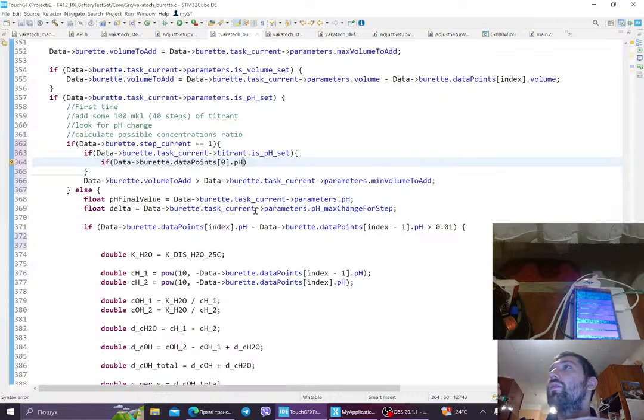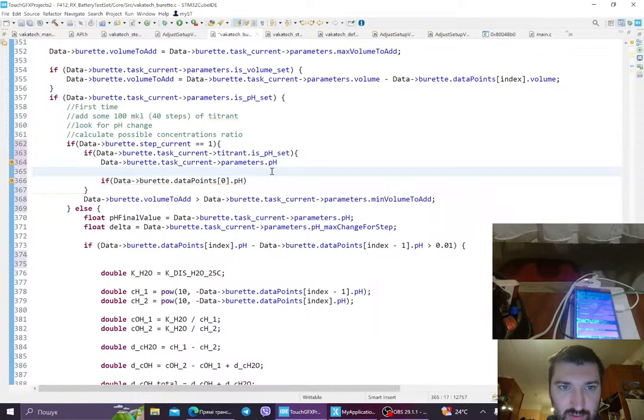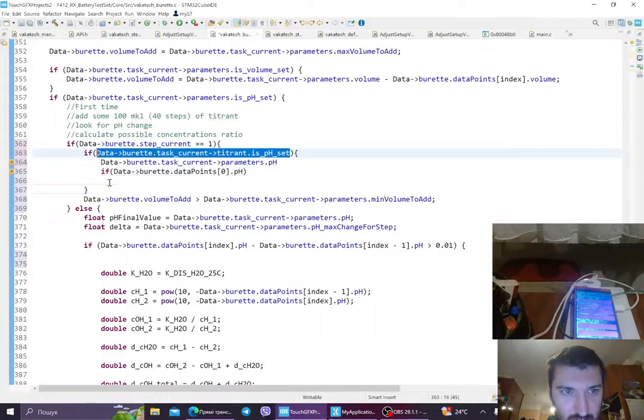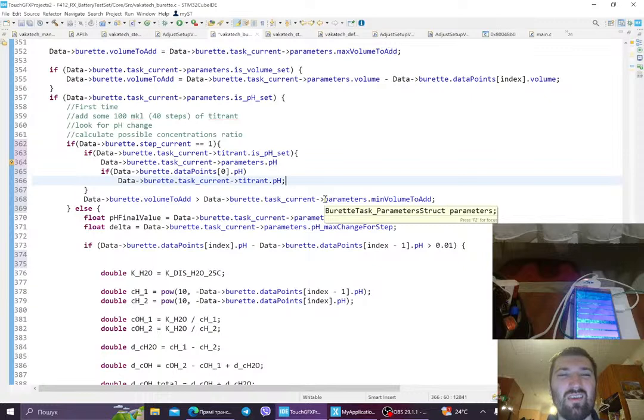So what do we have to do here? If titrant pH set, and if we notice pH, we have 3 points. We have a target parameters pH, this is the pH where we want to go. This is the pH that we have, and this is the pH of the titrant. And what do we have? If the current pH is on the other side, how do we make it mathematically?